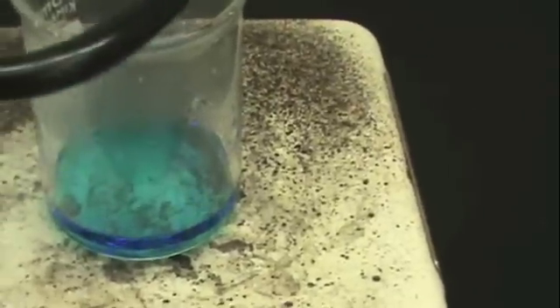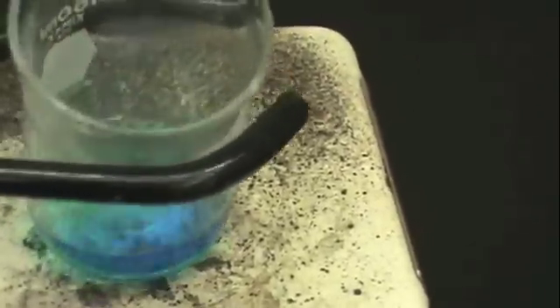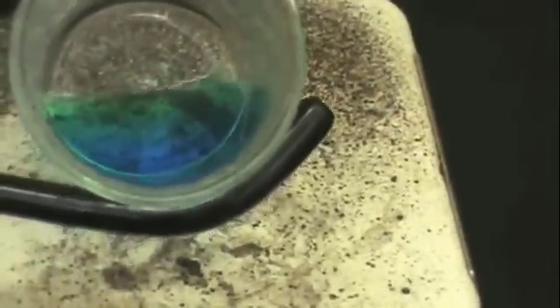When the copper is totally dissolved, you can use your tongs to remove the solution from the hot plate.